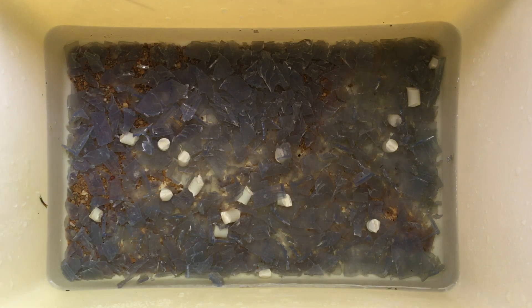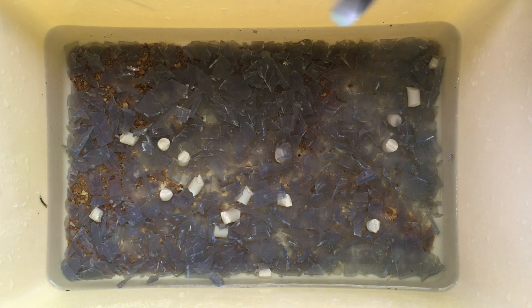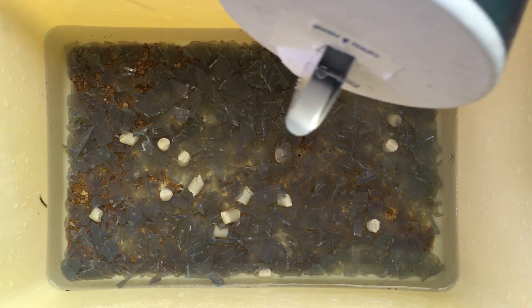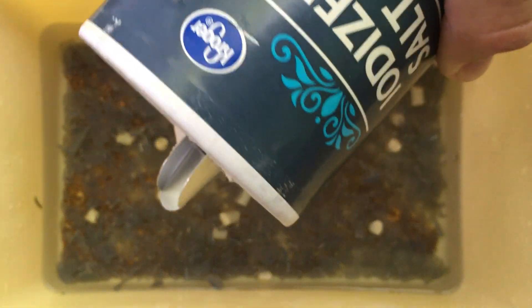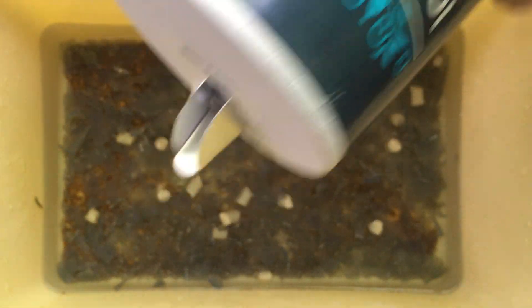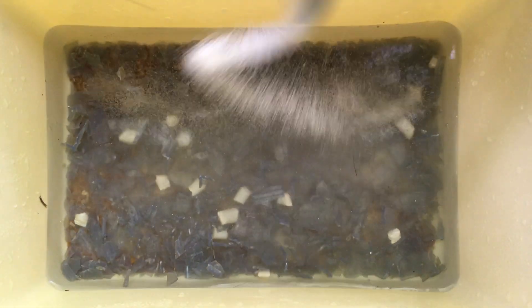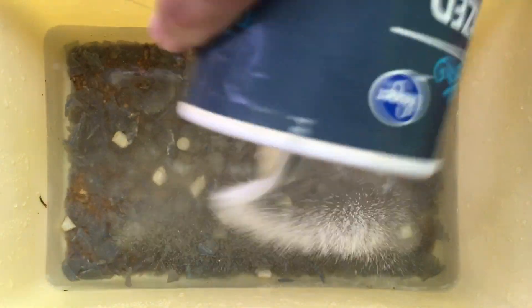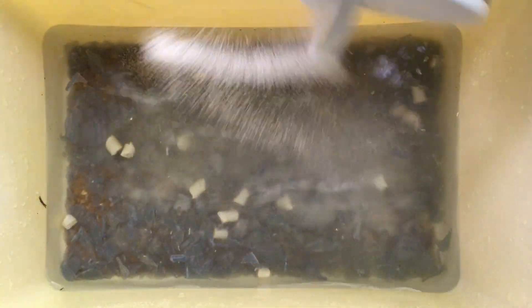What I'm going to do is start to separate the plastic from the sand by exploiting a density change in water. I'm going to add some salt here — sodium chloride — and it's going to make the water more dense.